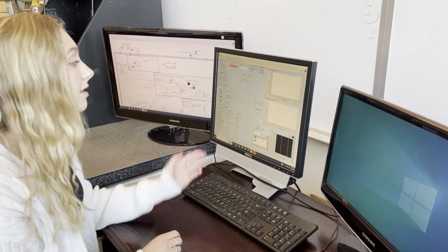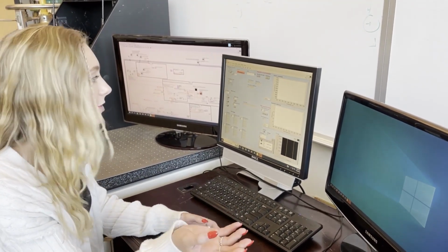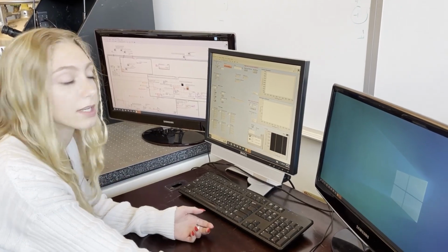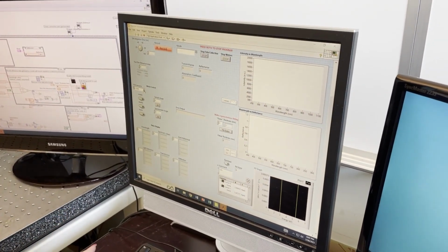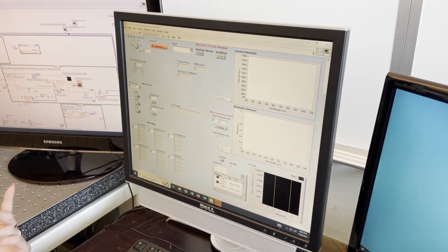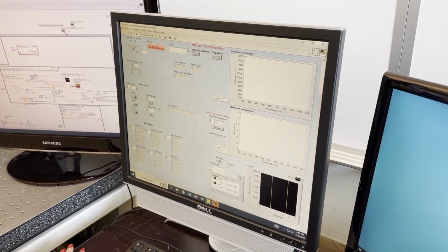This is the VI that controls the motors and takes information from the spectrometer in our machine setup. The first thing you're going to need to do is make sure it's connected to the Arduino that controls the motors by changing the VISA resource. Ours is COM5. Depending on the computer and the connections, it might be different. So just change that if necessary.